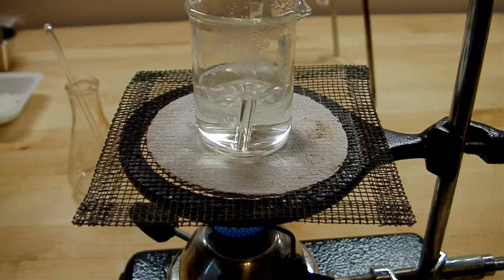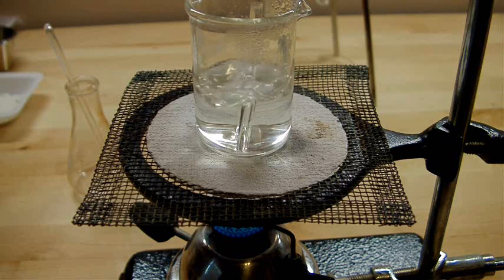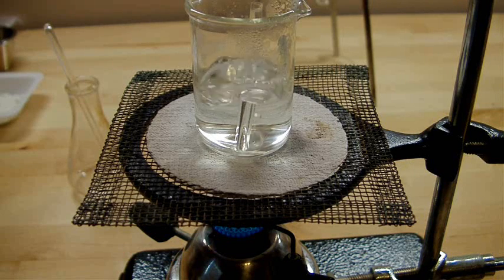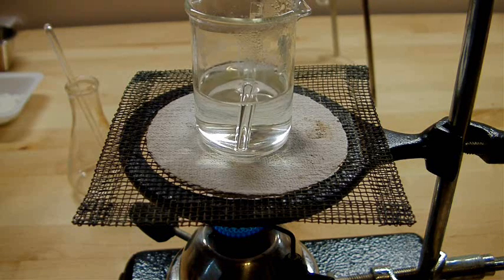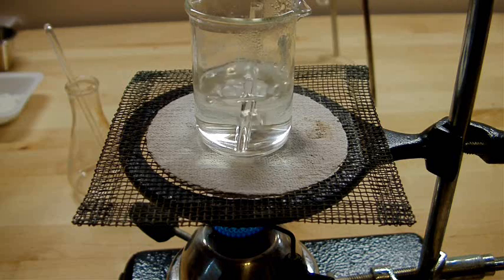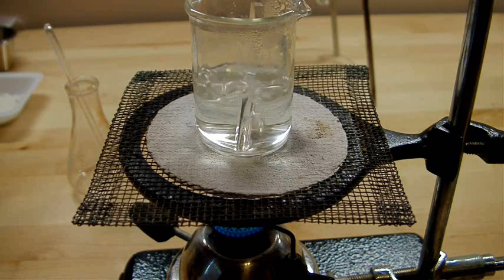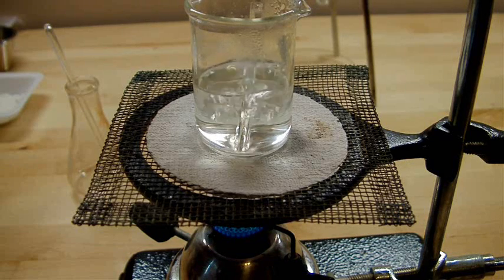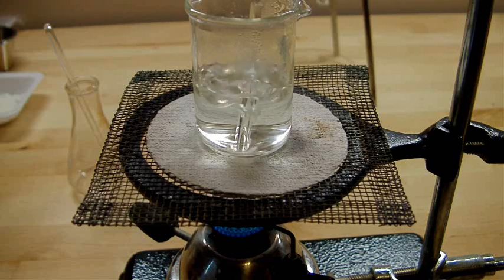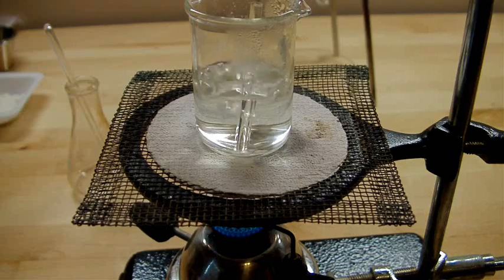Now I'm going to take my filtered solution of potassium iodide and boil it down to crystallize everything out. In lieu of boiling stones, I'm using a short length of glass tubing that I had lying around because it's generally a good idea to have something in there to prevent something called bumping where the solution just suddenly boils and it can throw some of the liquid out of the glass. And it's even doing that a little bit still. But having something with a rough surface in there usually helps to prevent that.